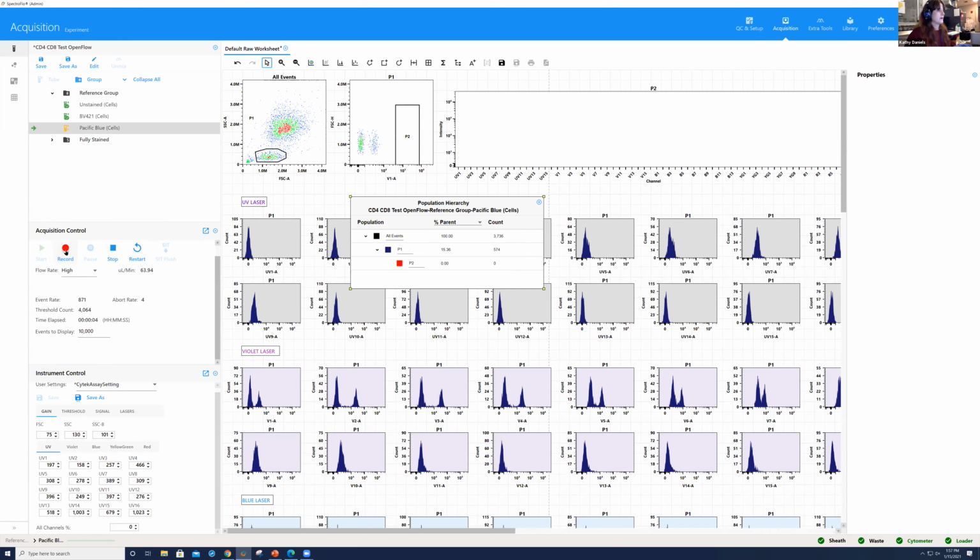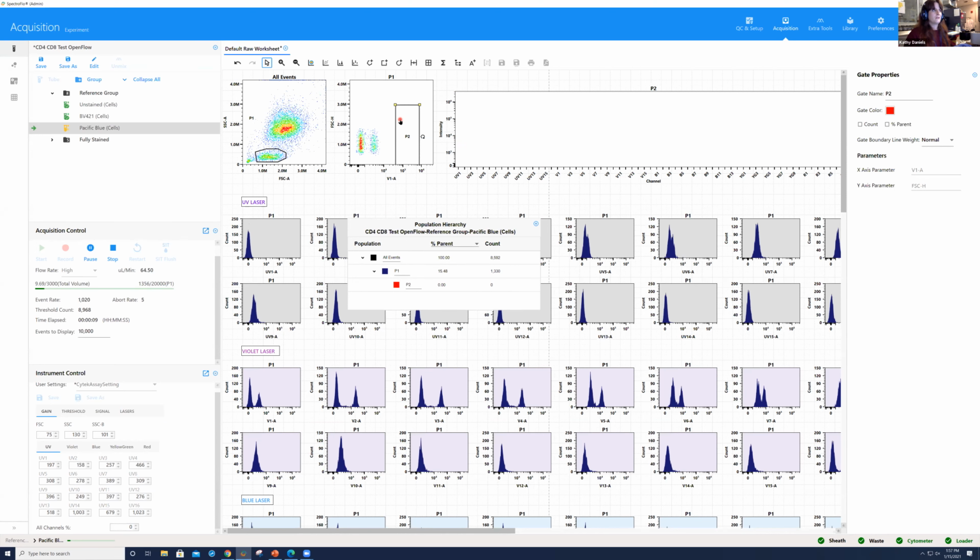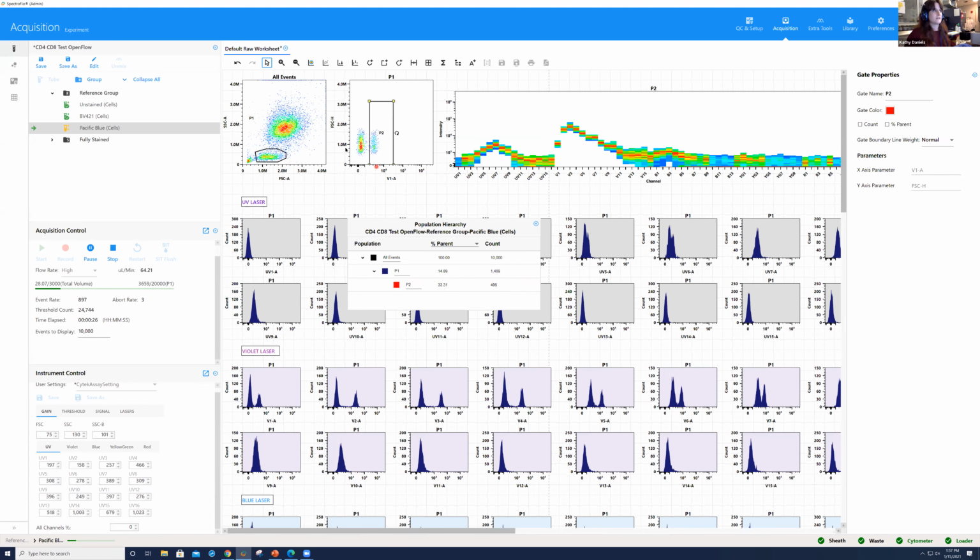There it is. I'm going to go ahead and select record. Now you're going to notice I don't see anything on this full spectrum plot anymore. That's because it's gated on P2 and there's nothing in this P2 gate. If I shift this over, what you now see is the Pacific Blue signature. And you'll see that it's actually much brighter on V3 than it is on V1, which is why this has shifted down so much, okay?